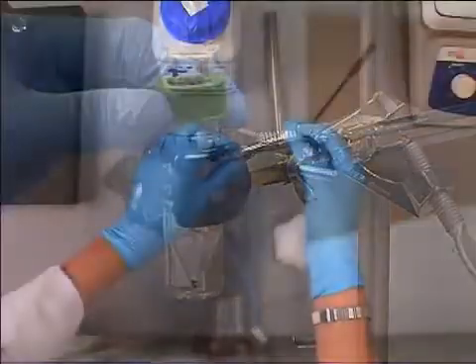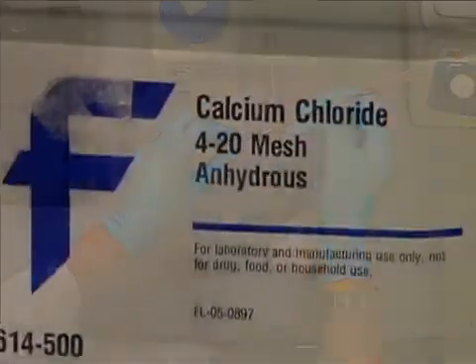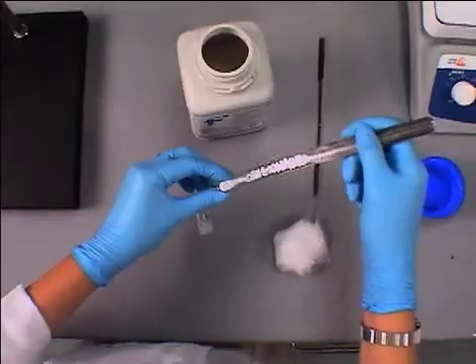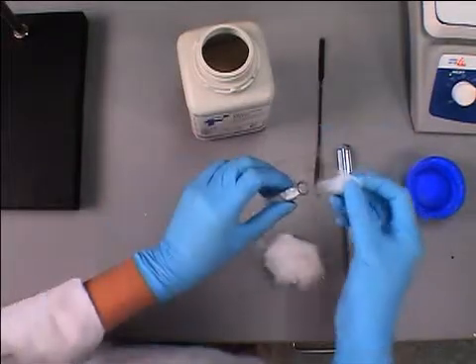Now assemble a drying tube. First, pack cotton in the tube, followed by the drying agent, anhydrous calcium chloride, and then additional cotton.